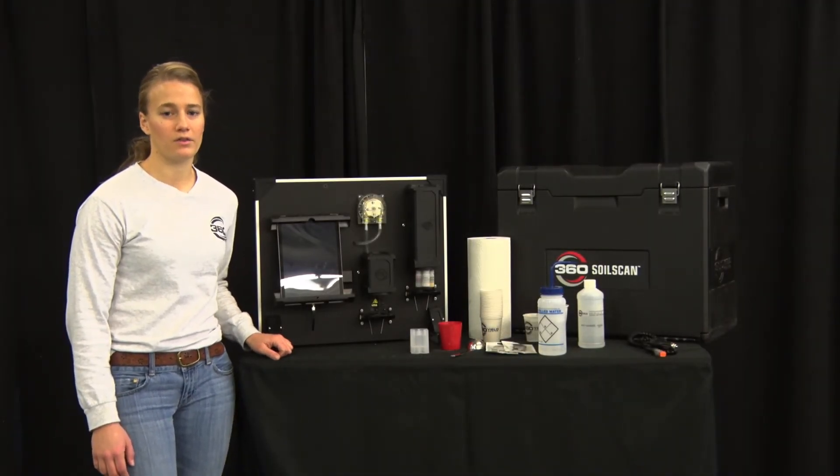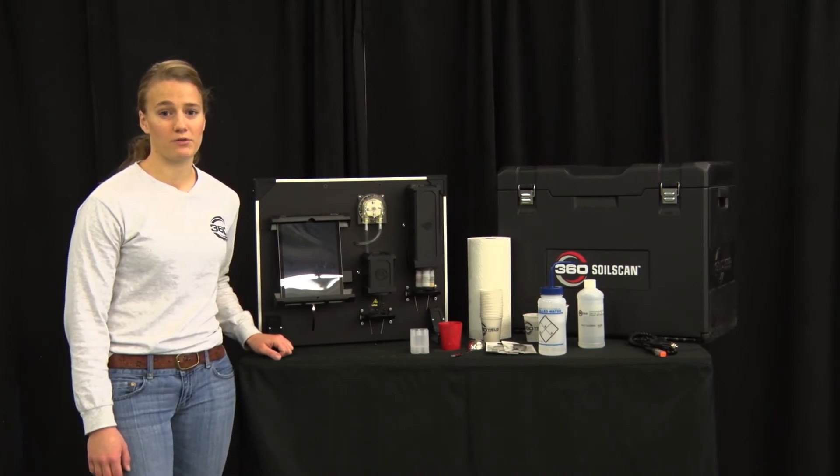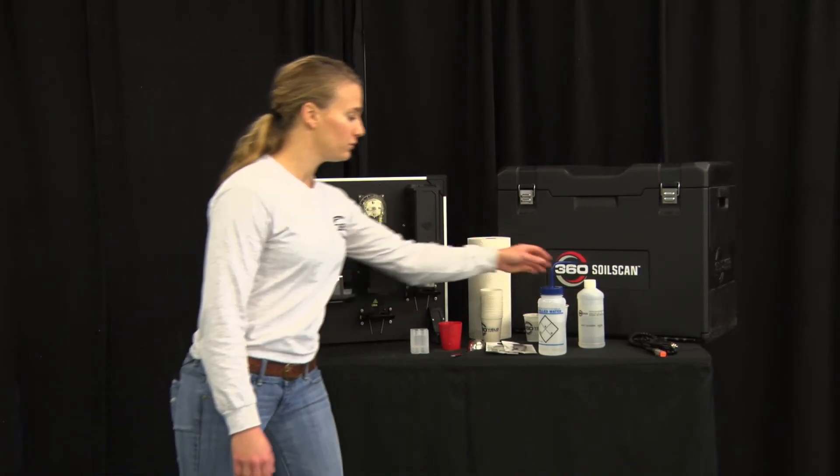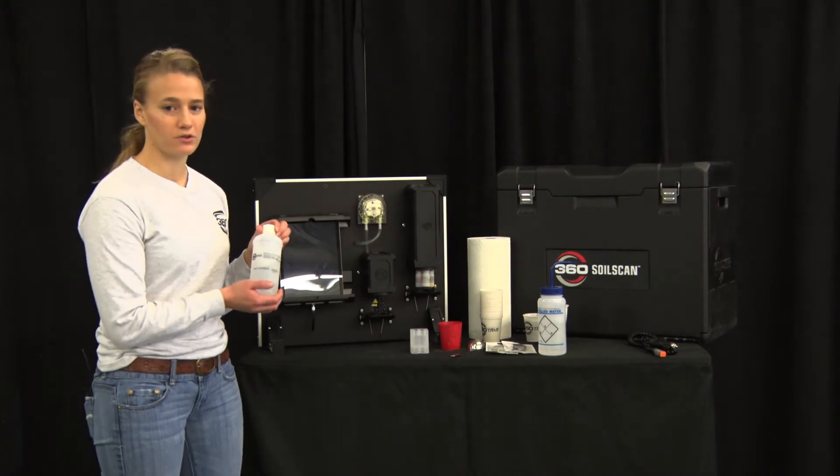The three parts that you want to replace every year are the gray nitrate sensor and the red reference tip. You also want to get new nitrate solution every year.